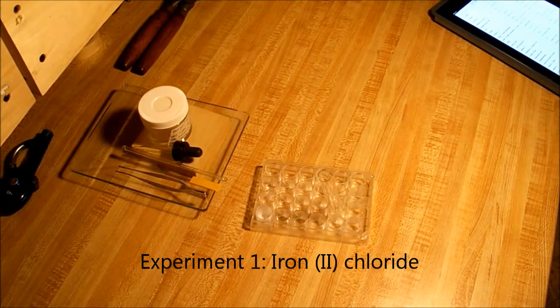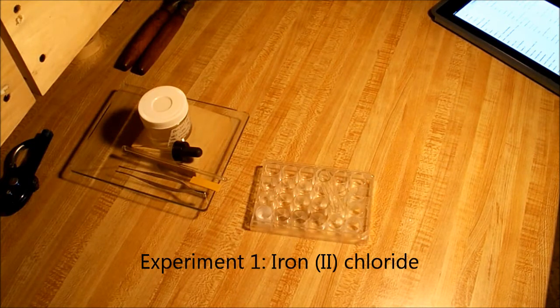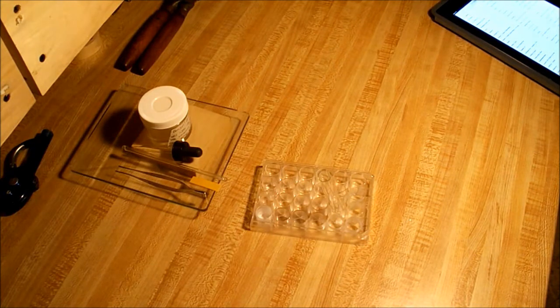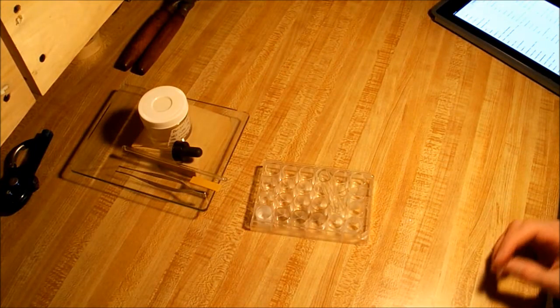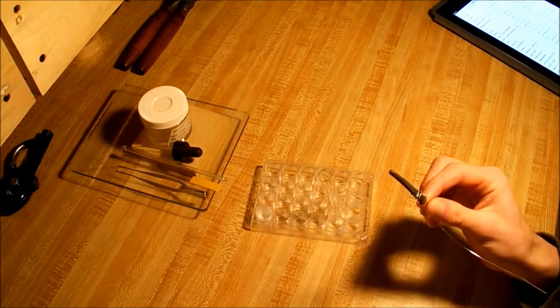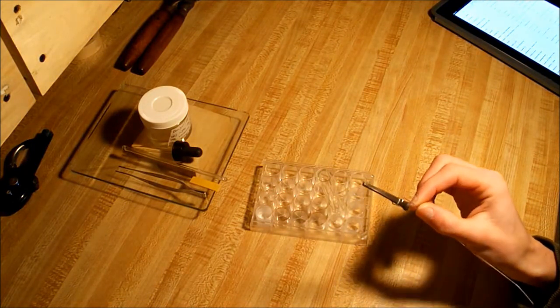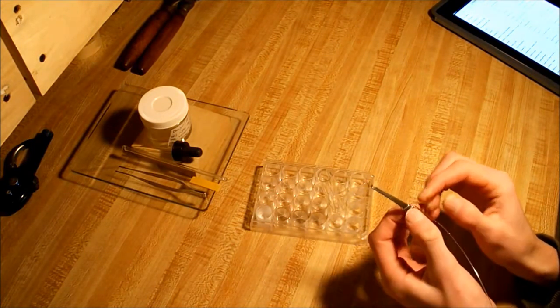Our first experiment today is making iron chloride and hydrogen gas. This one is the longest experiment so we're going to do this first and let it sit. But what you want to do is get just an iron nail, like in this case I have a horseshoe nail, and sand off any oxide to expose the shiny metal underneath.